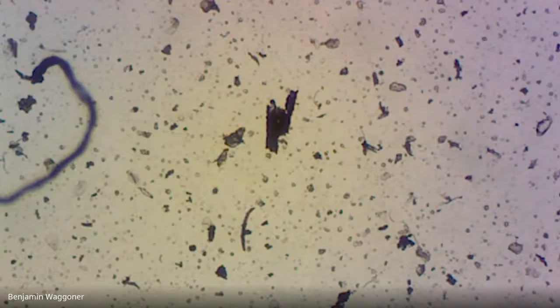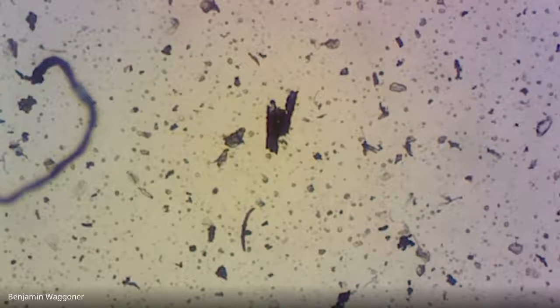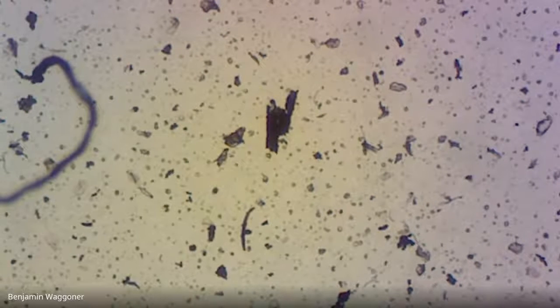Okay, so that's what it looks like once I've got all of that ooky stuff off the eyepiece camera and the lens. And that was the condenser that I'm dropping down. So let's focus on the slide. Oops, something just went swimming there.